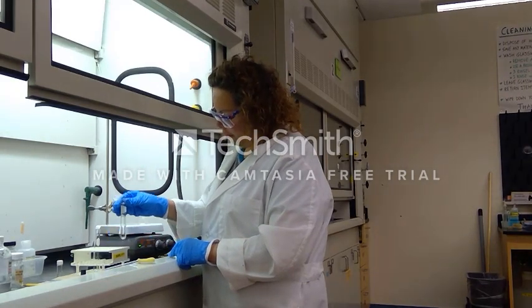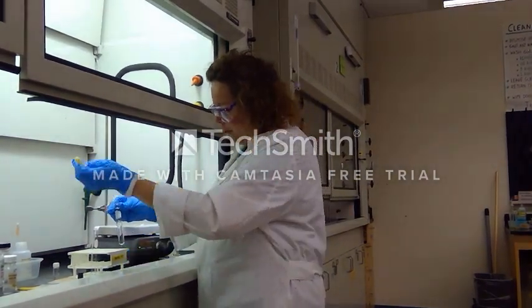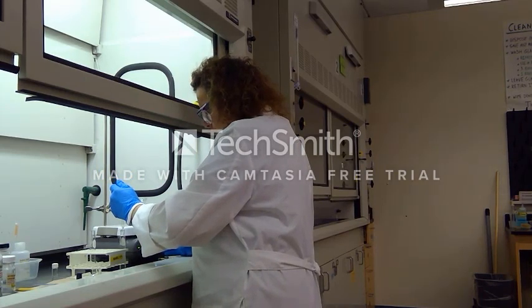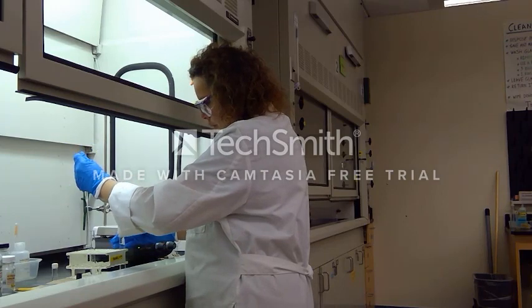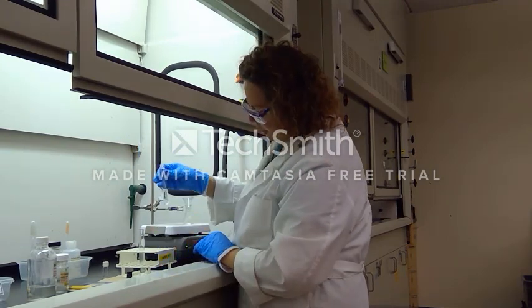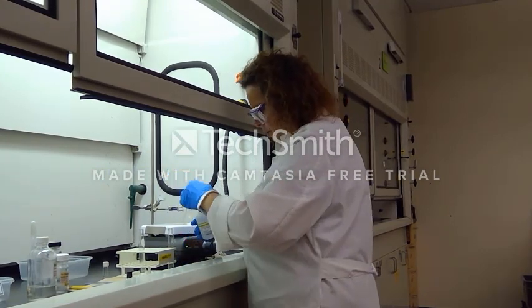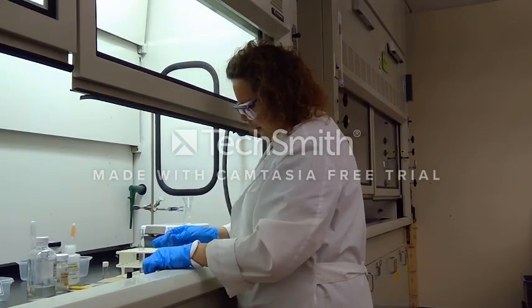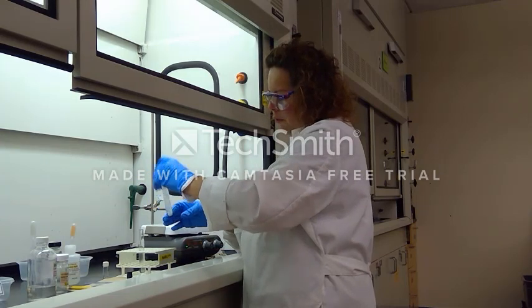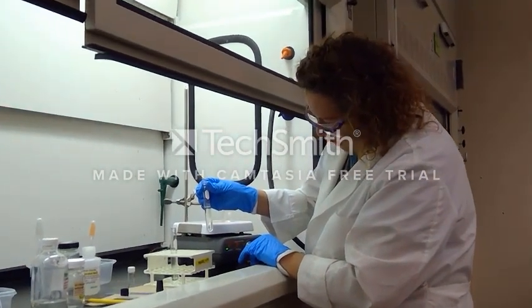I have poured my reaction solution into a separatory test tube and let the two layers settle. I'm using a long pipette to remove the lower aqueous layer. Since we added extra bleach and ethyl acetate to our reaction mixture, I have quite a bit of aqueous layer to transfer. After removing the aqueous layer, I am washing my organic layer with three milliliters of saturated sodium chloride solution, capping the test tube and inverting a few times to move anything aqueous into the aqueous layer.